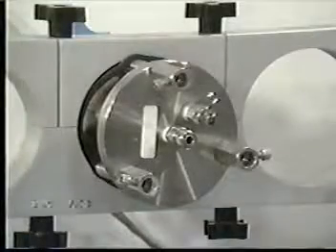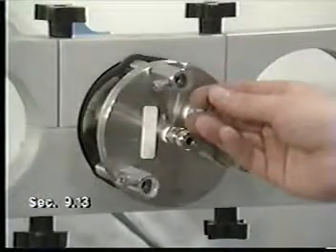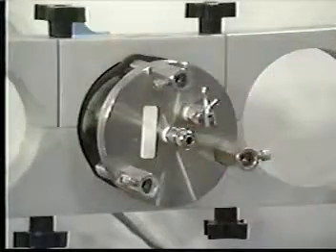After the agitation is complete, check that there is still pressure behind the piston by quickly opening the gas inlet-outlet valve and noting any escaping gas. If the ZHE has leaked, see the method for the appropriate corrective action. When the problem has been solved, redo the extraction with a new sample of the waste.